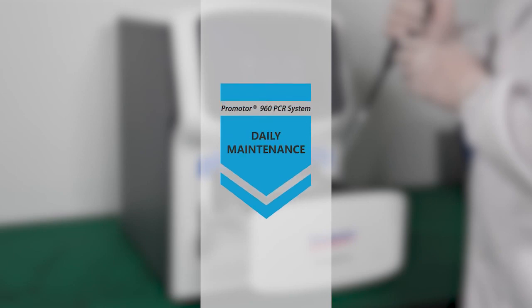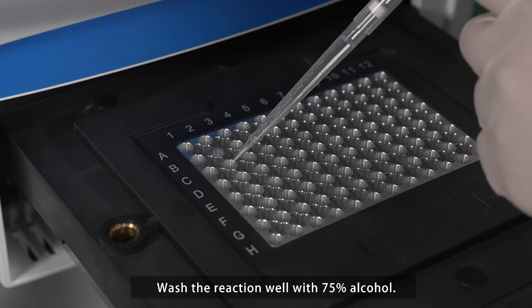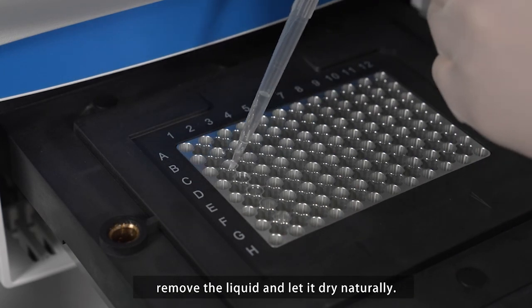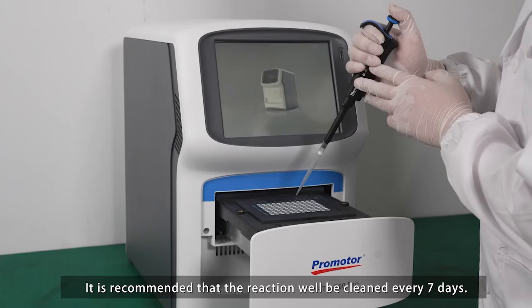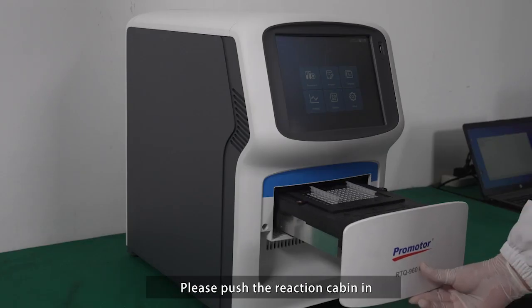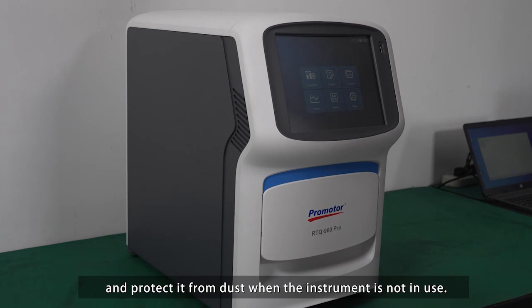Daily maintenance. Wash the reaction well with 75% alcohol. After soaking for 10 minutes, remove the liquid and let it dry naturally. It is recommended that the reaction well be cleaned every 7 days. Please push the reaction cabin in and protect it from dust when the instrument is not in use.